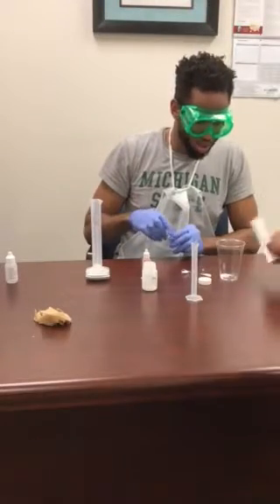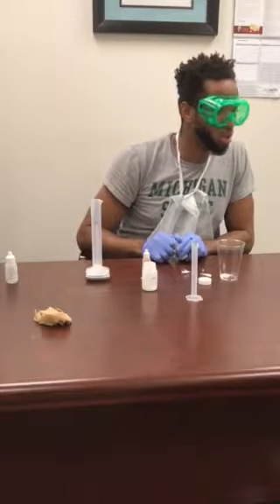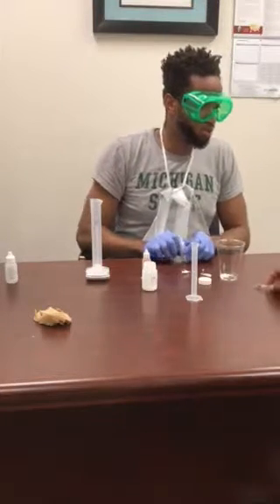It's kind of hard to open it with the gloves on. There you go.